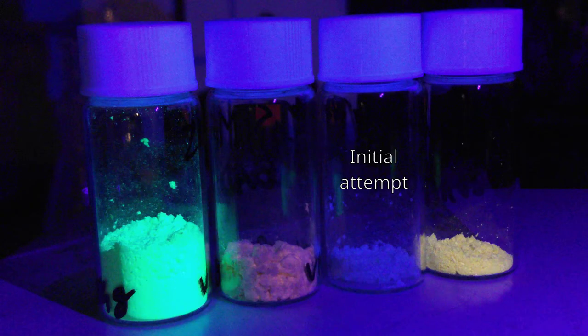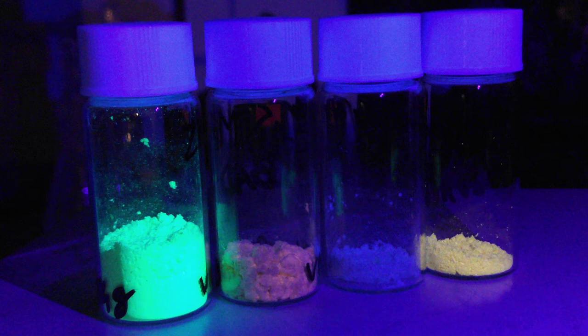From my experience, I found out that making this material with an acceptable brightness and without dark spots was considerably more difficult than the green version I made previously, which was copper-doped zinc sulfide.